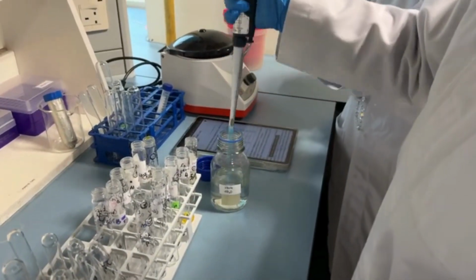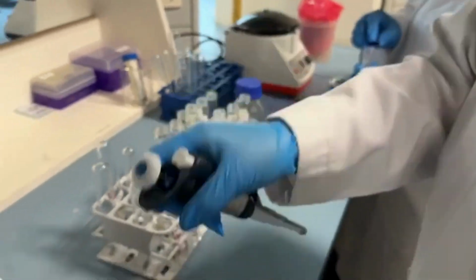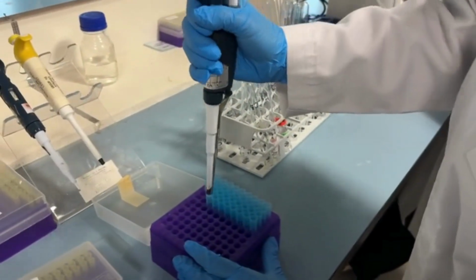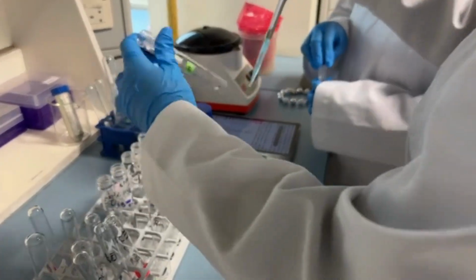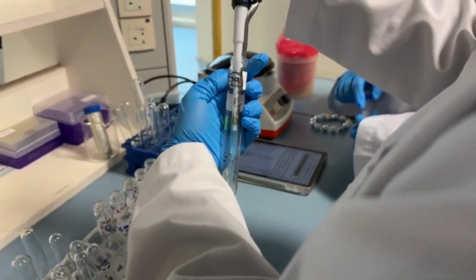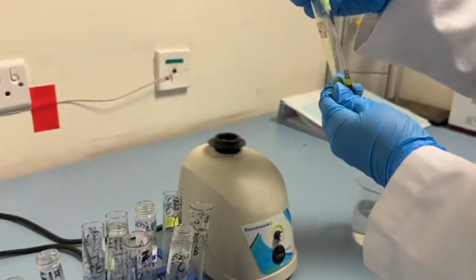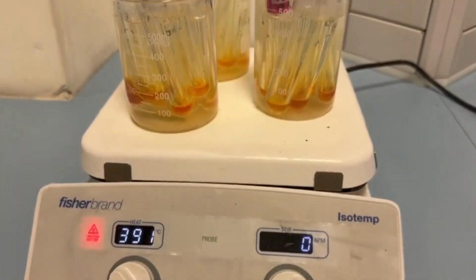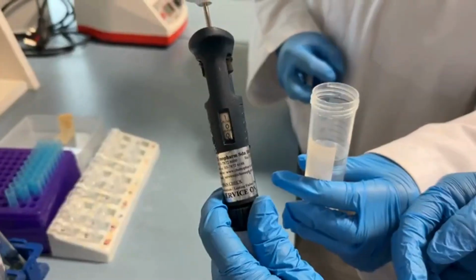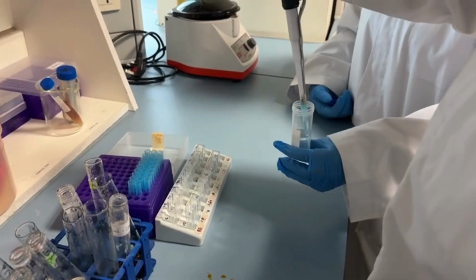Distilled water, glucose solution, and DNS reagent are pipetted in duplicate into a series of six dry, clean, and labeled test tubes. After the above-mentioned solutions are placed in the labeled tubes, the test tubes are shaken well and then placed in a boiling water bath for 5 to 7 minutes. The test tubes are cooled.